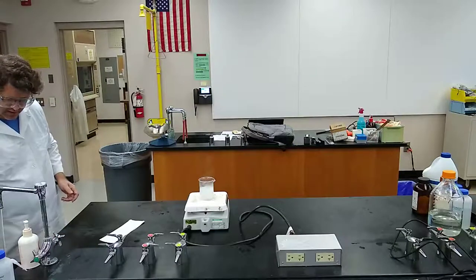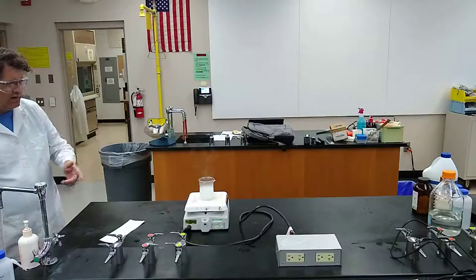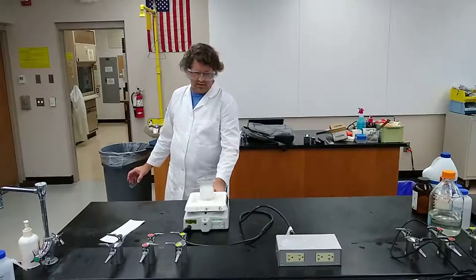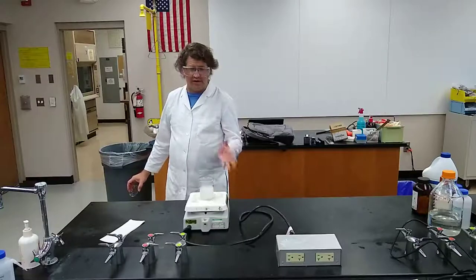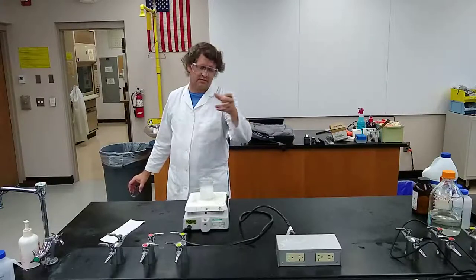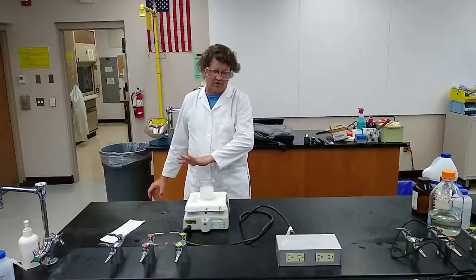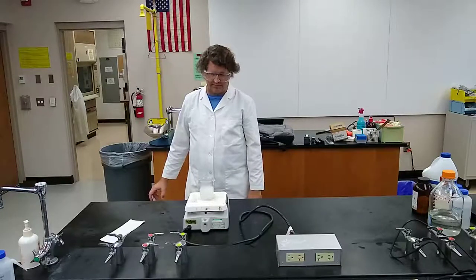The starch technically dissolves relatively fast. If it does boil over and foam up, it's not that big of a deal — just make sure once everything's cool, you clean off the top of the hot plate.